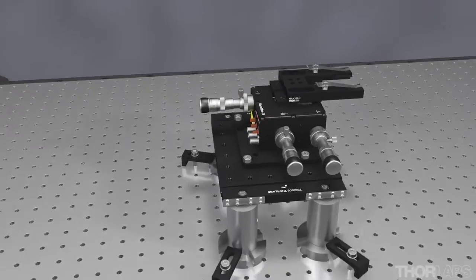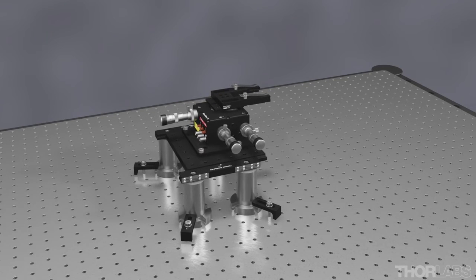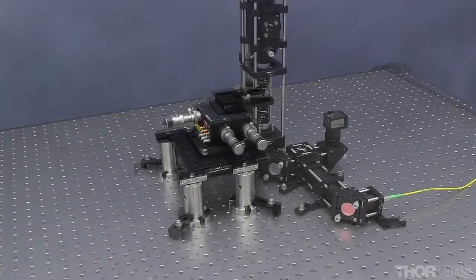Once assembled, slide the translating breadboard forward and position the slide holder in between the objectives of the tweezer system. Then secure the stage to the table.